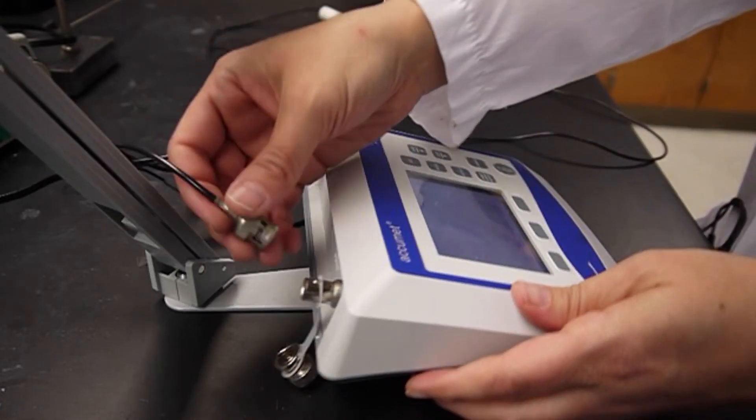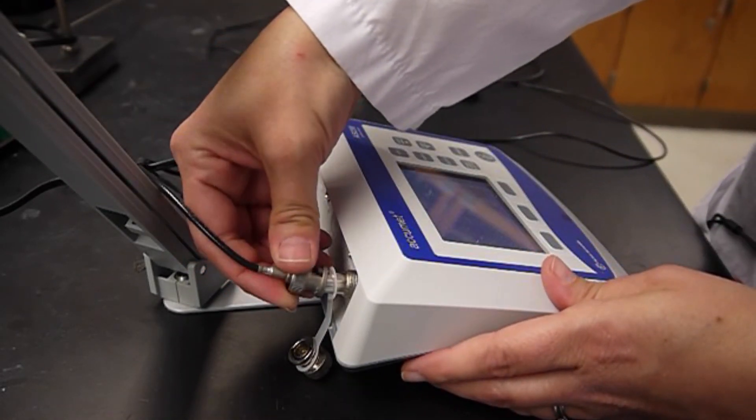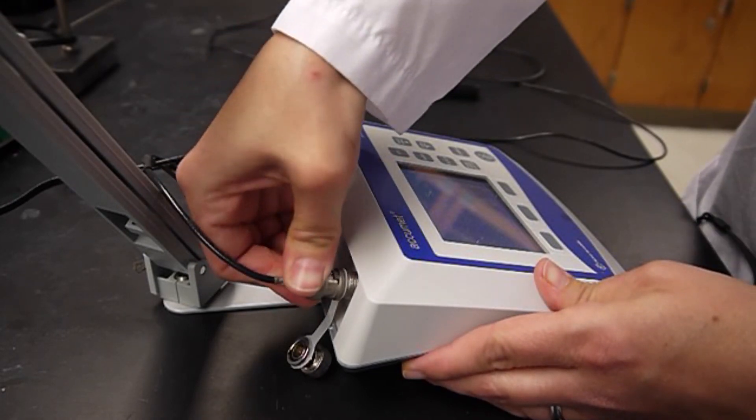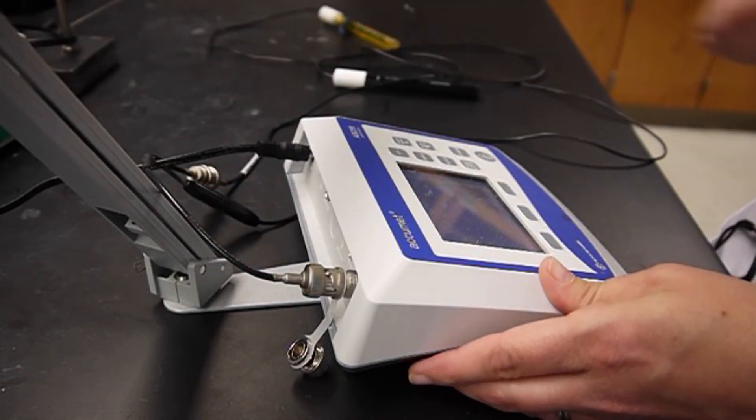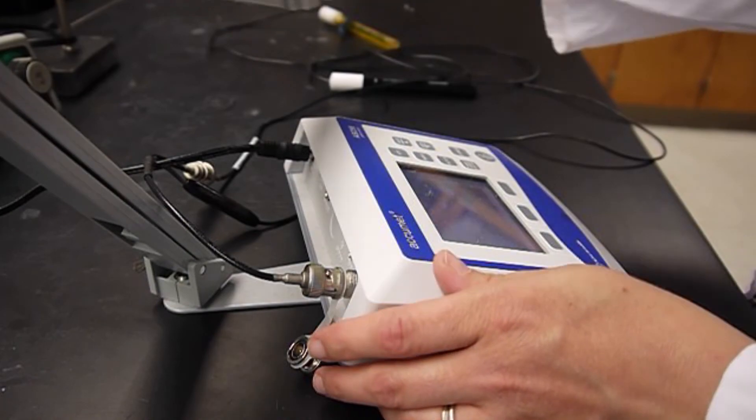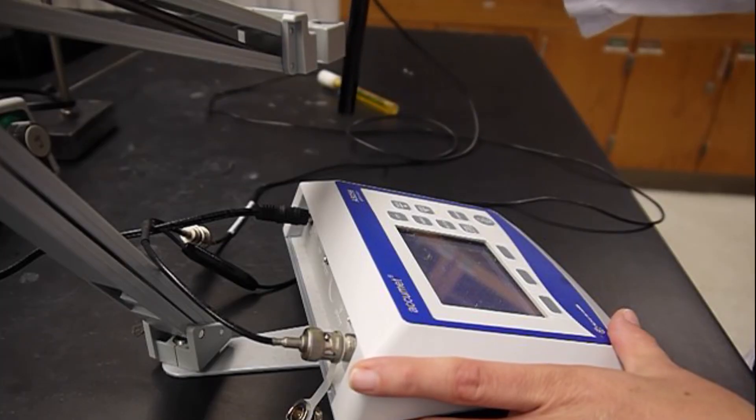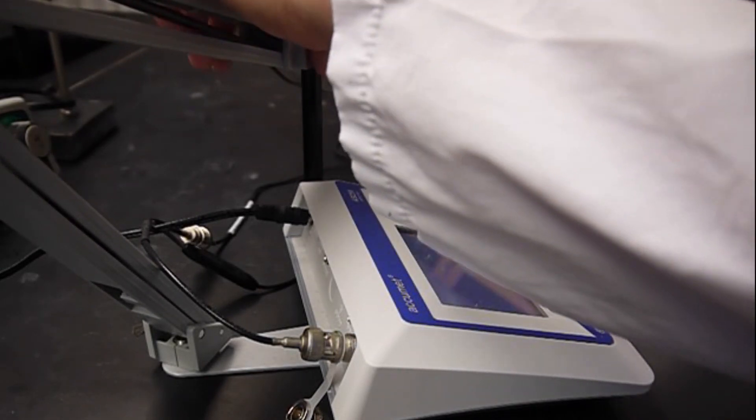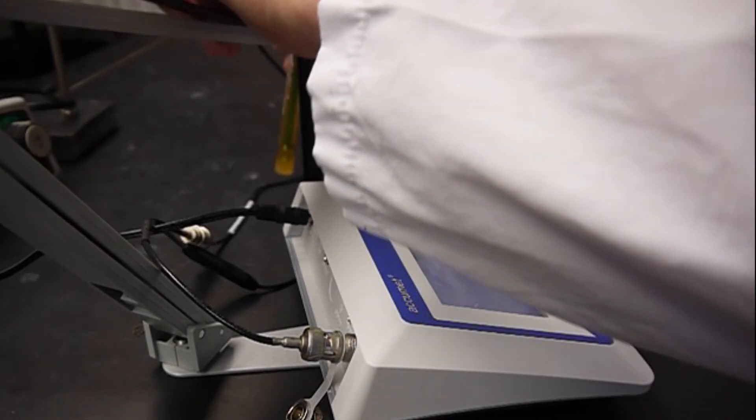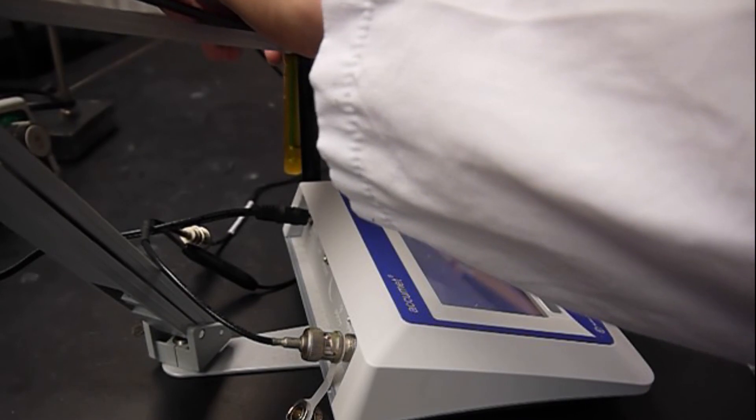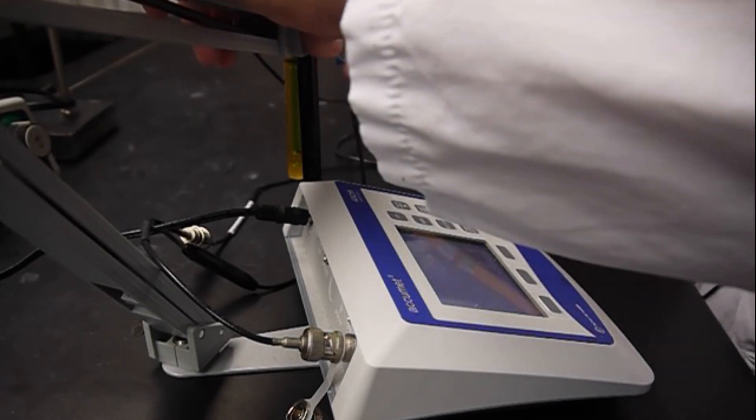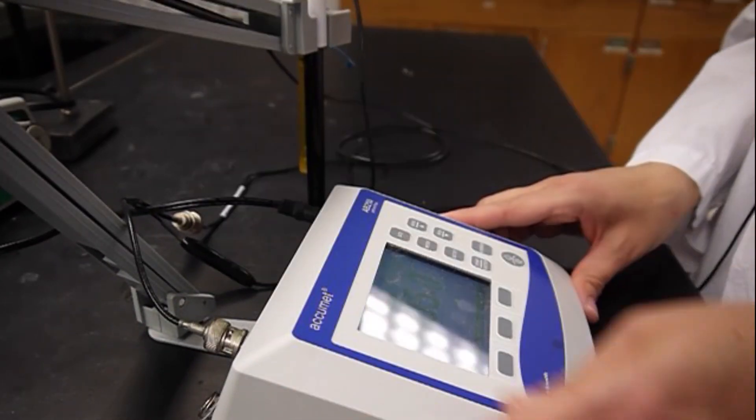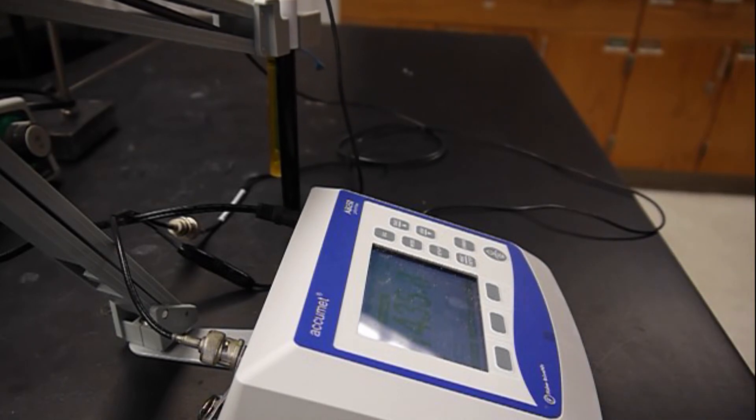Let's go in and turn just a little bit. Okay, so now we can connect to our meter. Like that. And we can place our electrodes on the stand. And we're ready to go.